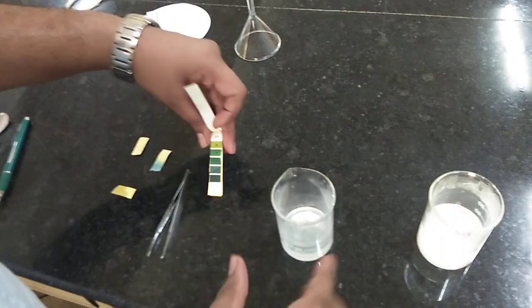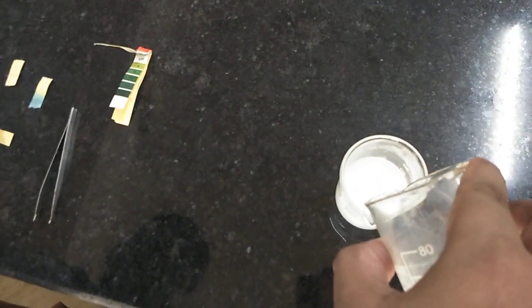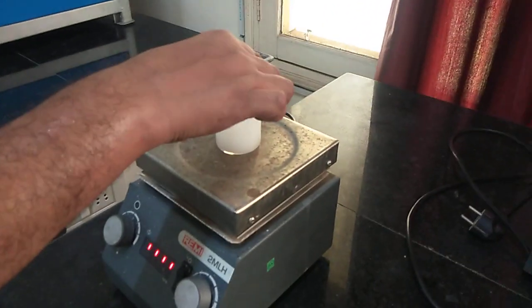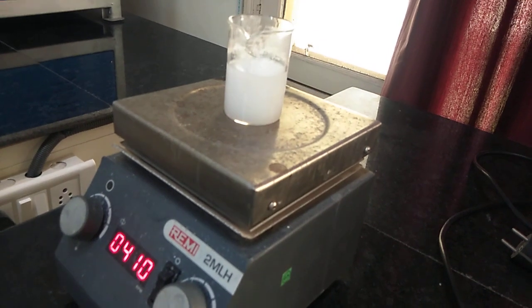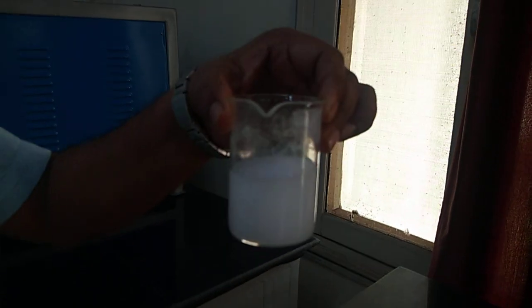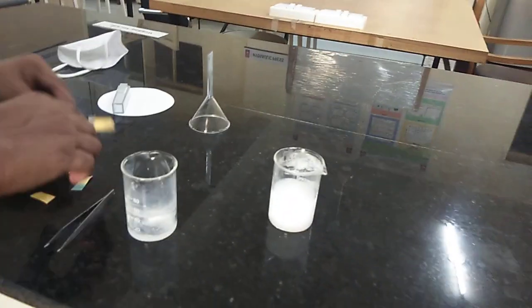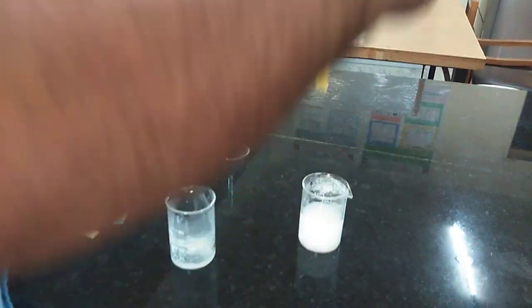However, the solution is still slightly acidic because the litmus paper color is still yellow. We will keep on adding NaOH drops until we get the green color indicating pH 8. After adding a few more drops and stirring for a few minutes, the solution is lightly milky — this is what we call the precipitate. Checking the pH again still shows approximately 7.